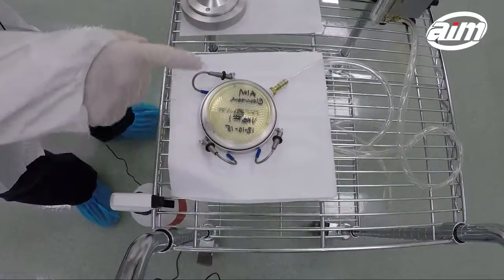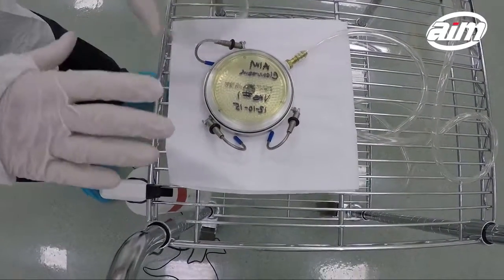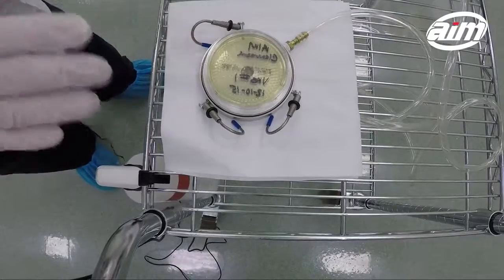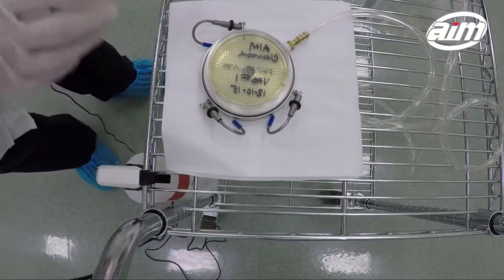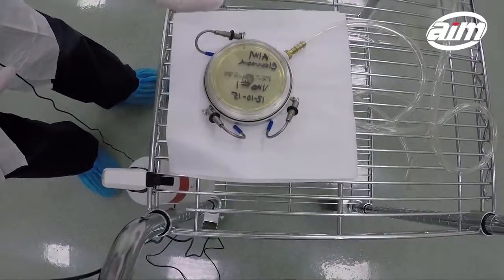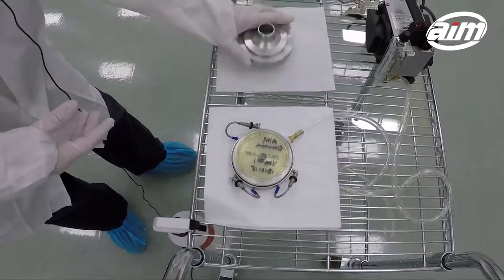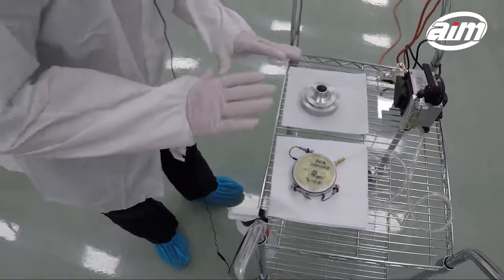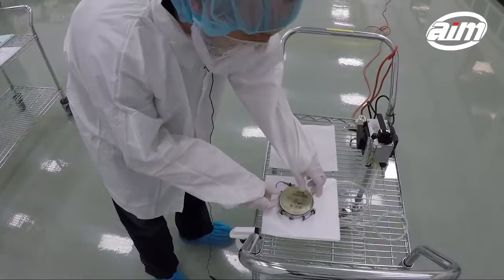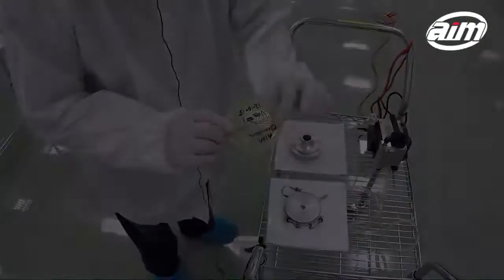As you can see, there are little bumps on the plate. That tells me that the pump and impactor did its job — that it drew air through all those microscopic holes, providing an equal distributed amount of air over the plate. You can actually visually see that on the sample plate.